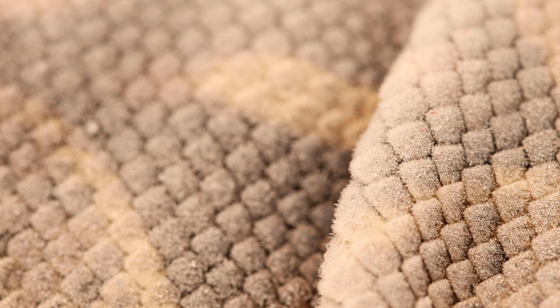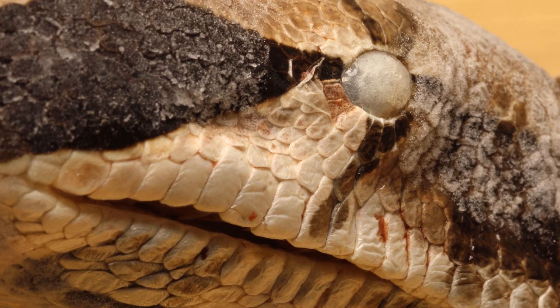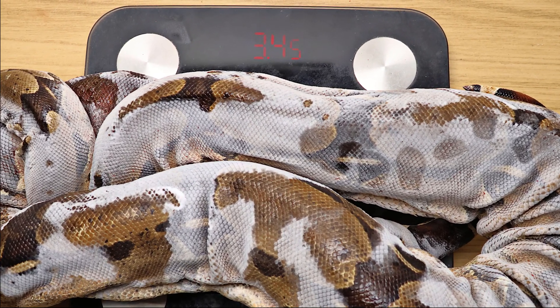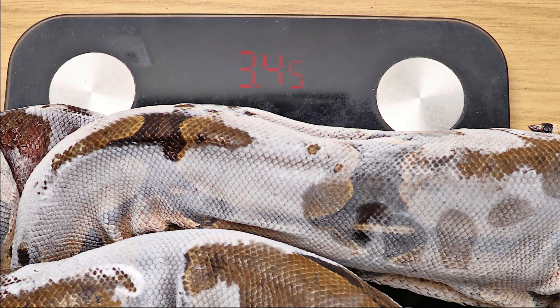It works for me and can easily be scaled up or down depending on what size specimen you're dealing with. I never measured this adult female boa constrictor in life, but I doubt she'd grown much in death by the time I measured her at 6 feet and 1 inch. I did have the foresight to weigh her before starting the process and she came in at about 3.5 kilos, which is about 7.75 pounds.